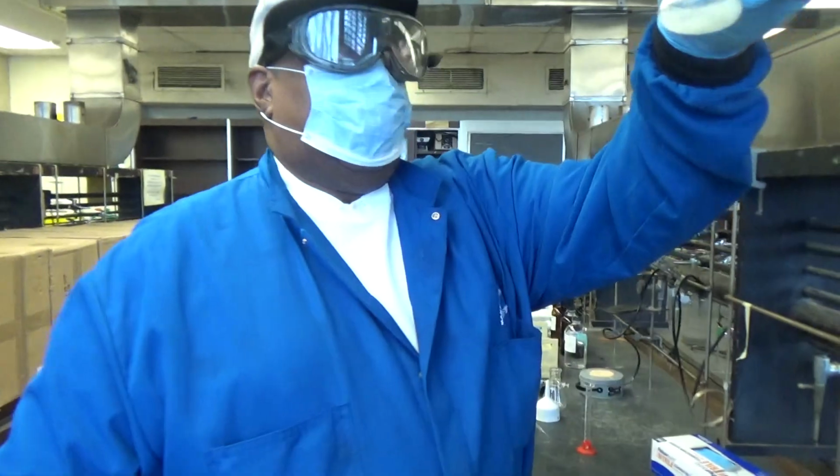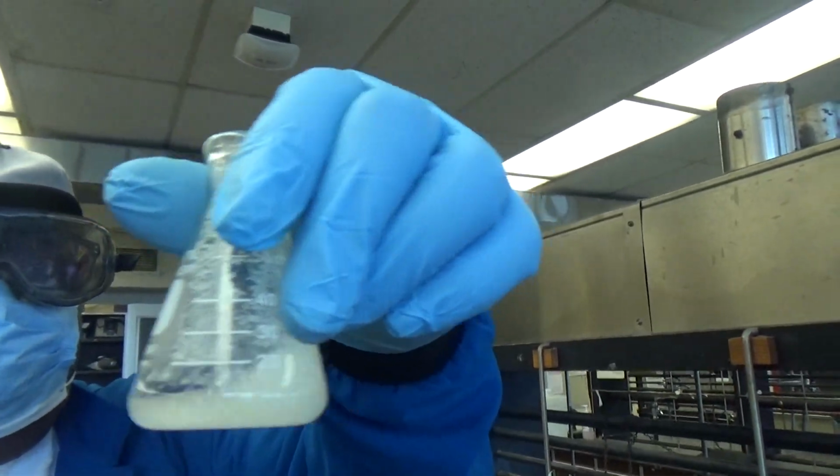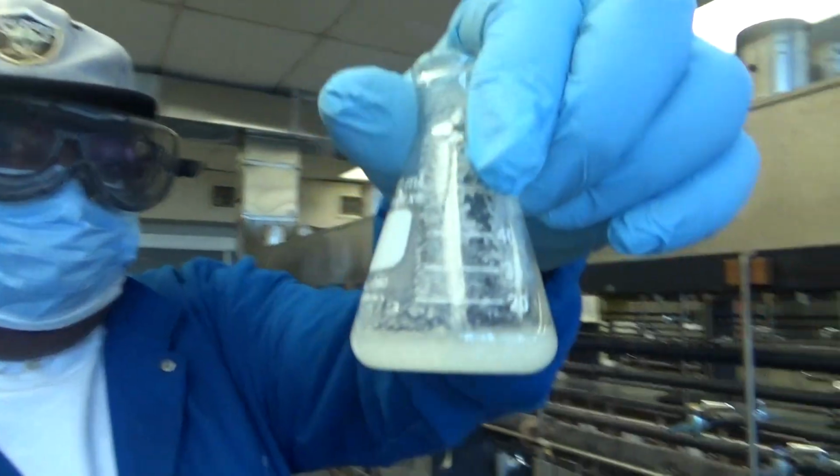So now, as you can see, you have your pure benzoic acid crystals in the water. That's good.